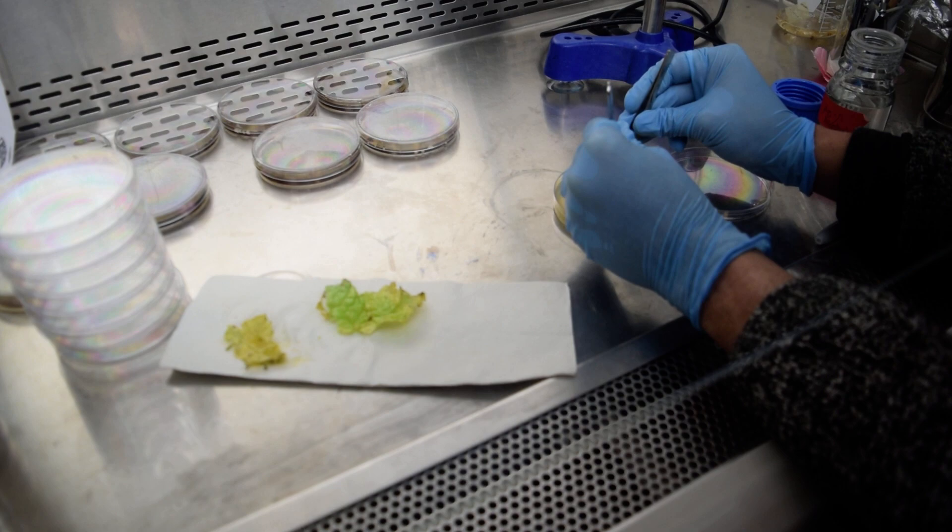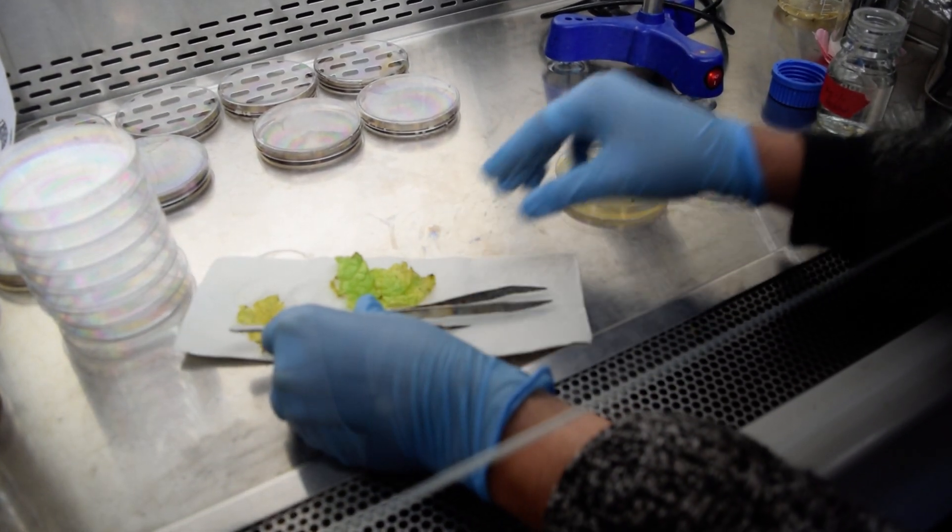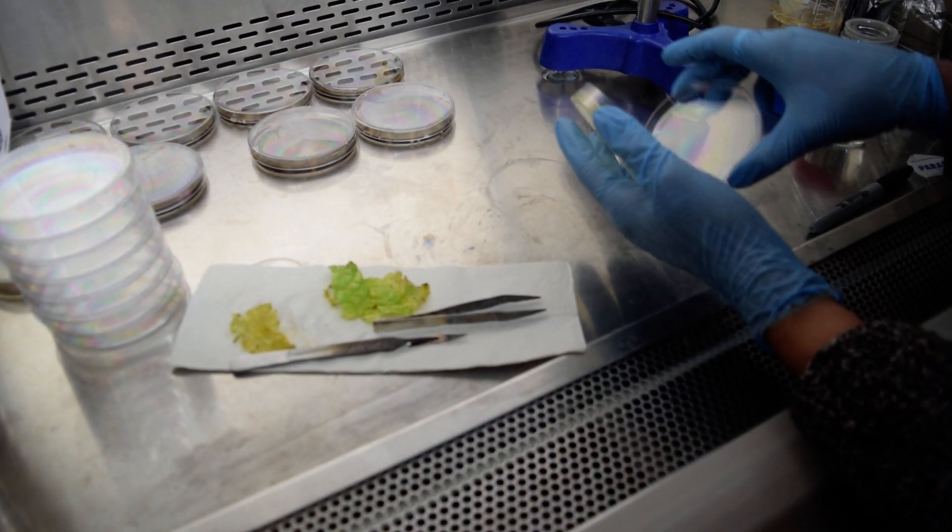We are transferring five pieces of samples, and we have to flip it over.